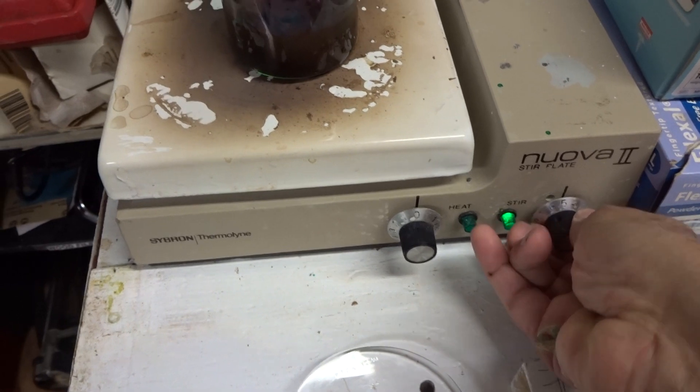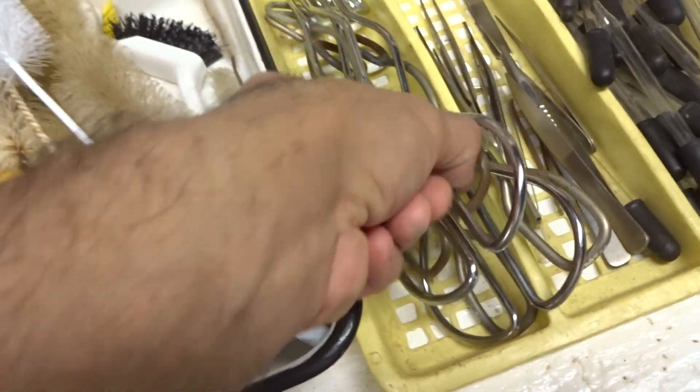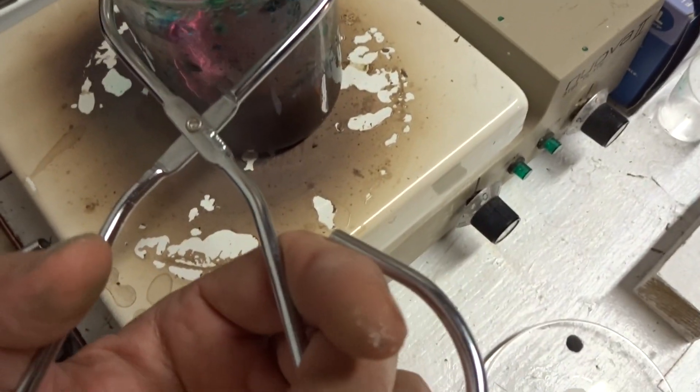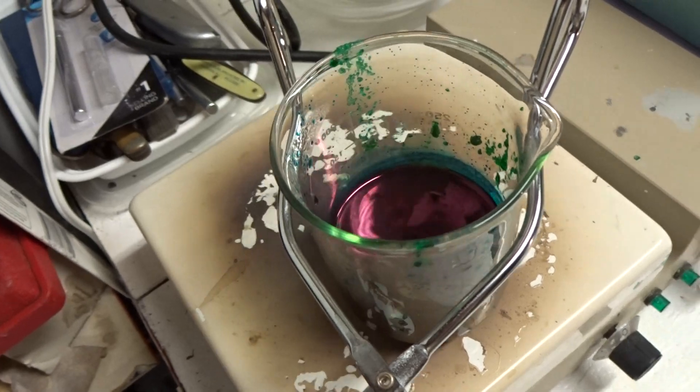This has been on for a while. Turn off the stirrer. This couldn't be hotter. Please don't let me drop it — I'm a small testing lab that barely makes any money.